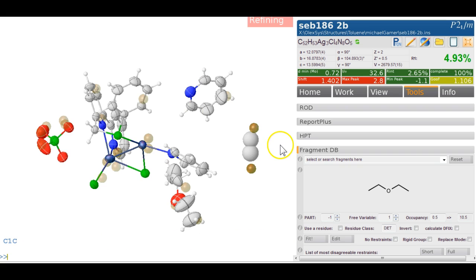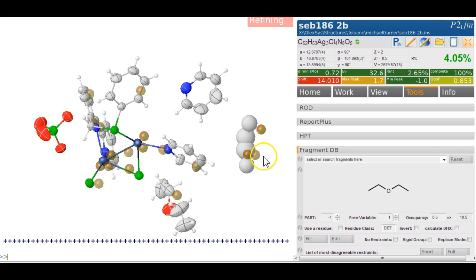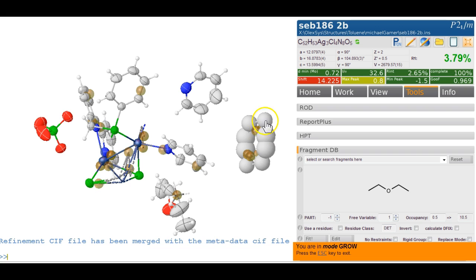Yep, there are more Q peaks around it. They're 1.7, so they're quite sizable. Let's just press on and make more carbons out of them and see whether we can eventually see something, or anything that makes some sort of sense. Control G. It's not finished yet. Control G. Oh yes, it grows.